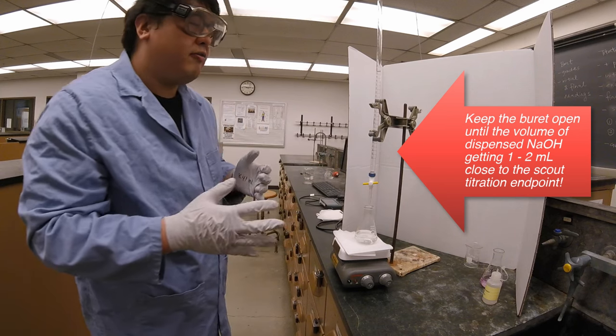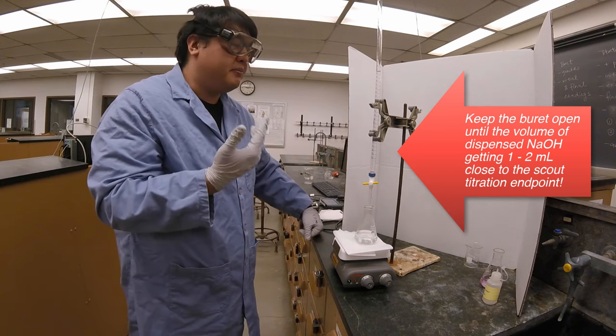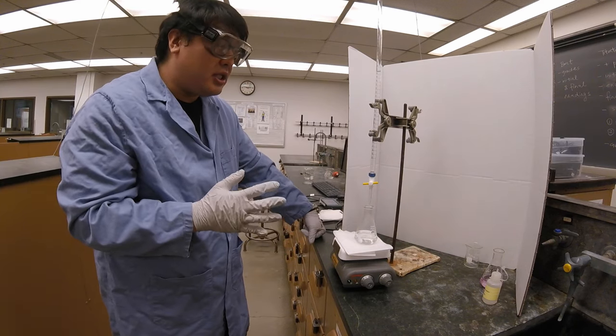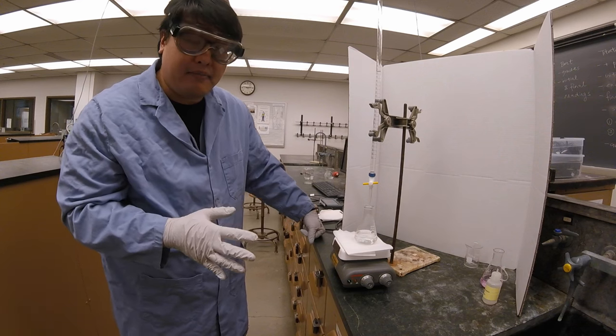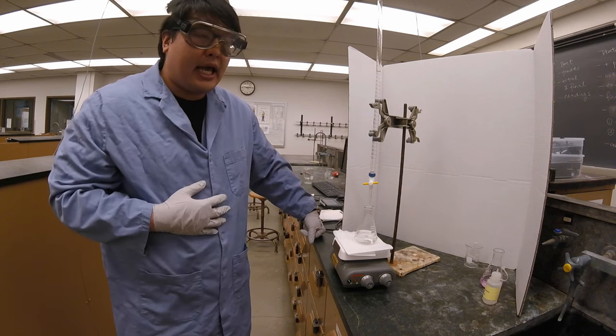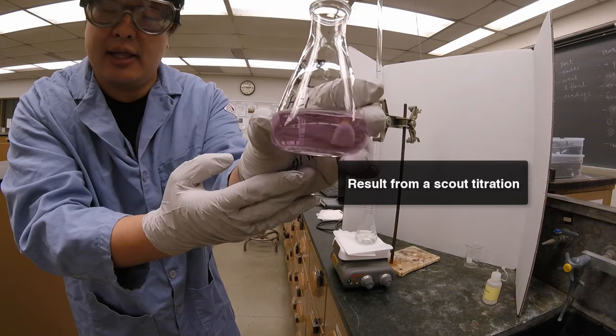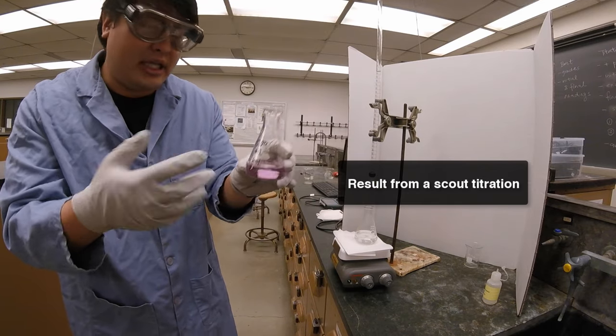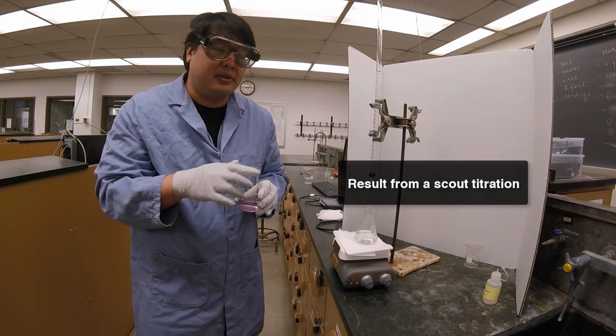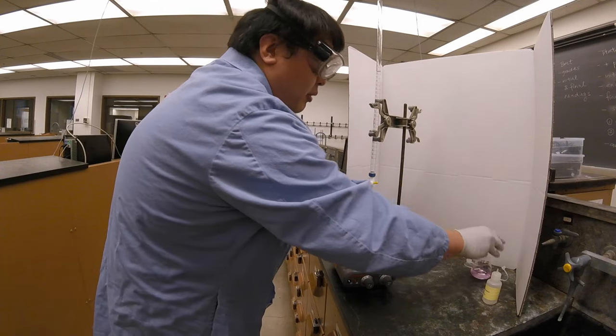Right now, I've already added about 23 milliliters of the base, and you know from our scout titration that we overshot this pretty badly and used about 27 milliliters. So right now, I'm going to slow down.